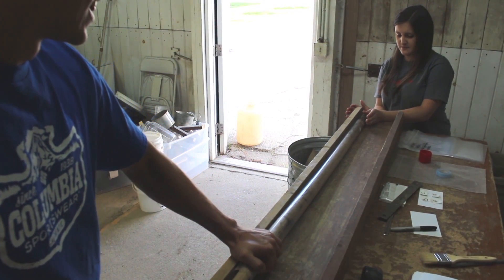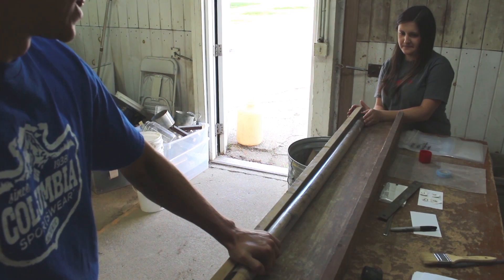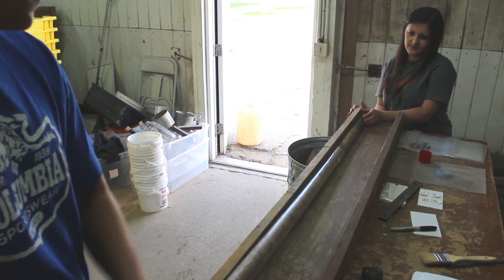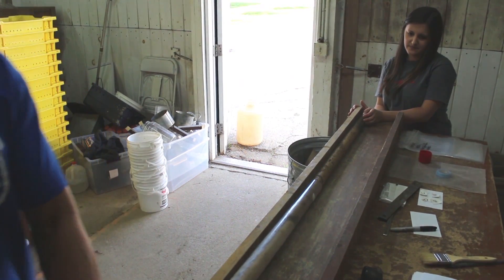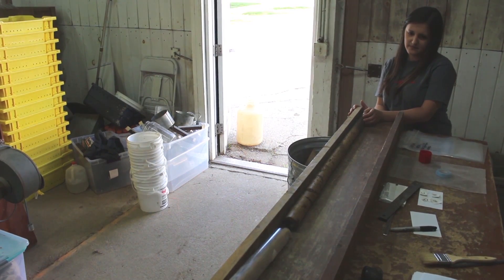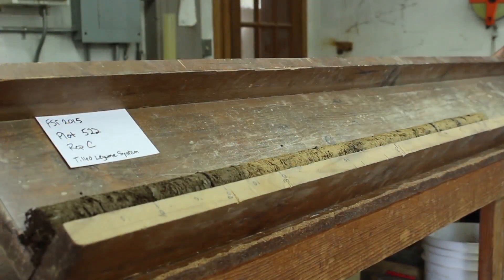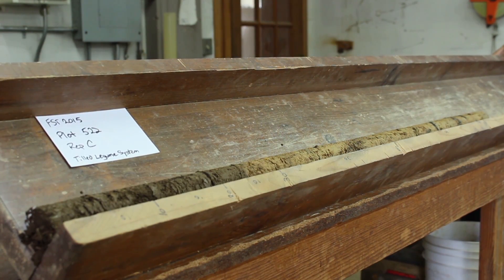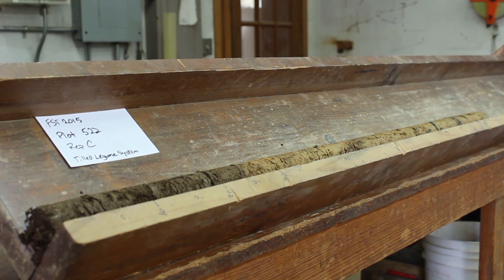The soil core is pushed out of the tube to determine the A and B horizons of the soil. After that, the soil core is ready to cut. On average, the A horizon — where the organic matter is in the soil — is longer in the organic treatments as compared to the conventional treatments.